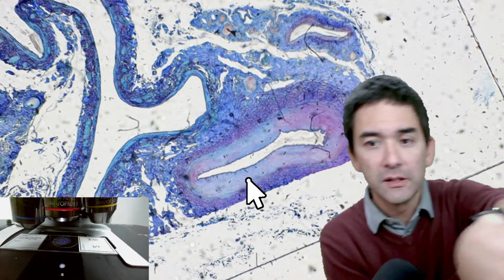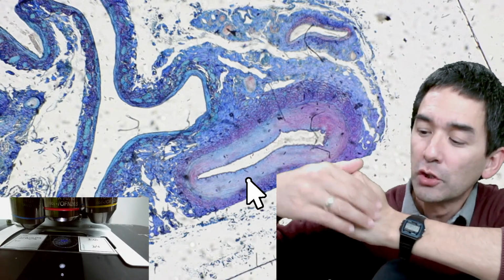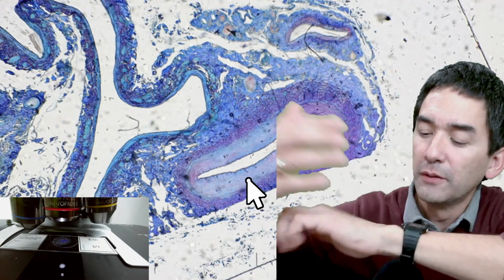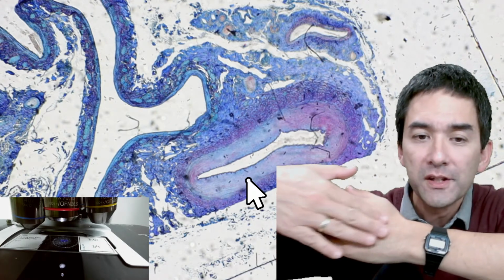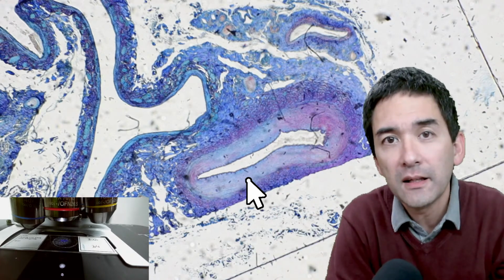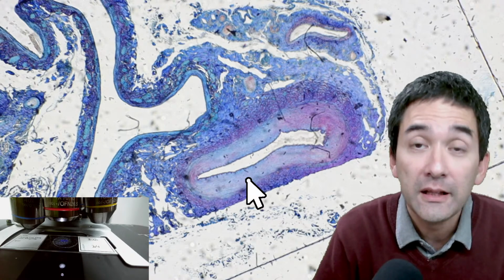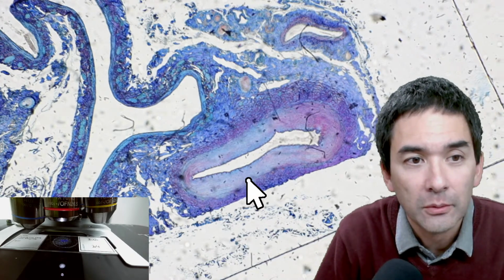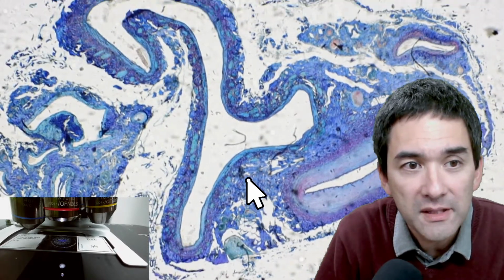I mean, it's difficult to see here. Sometimes you see blood vessels on the surface here, okay? And these are difficult now. I don't have so many right now, but blood vessels that you see on the surface here, these are veins, and they carry blood of a low blood pressure back to the heart, and therefore their wall does not have to be so thick. And look, it's almost difficult to find, but this here, let me center it.